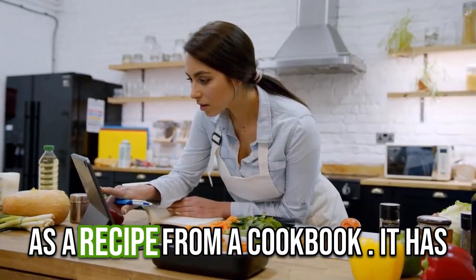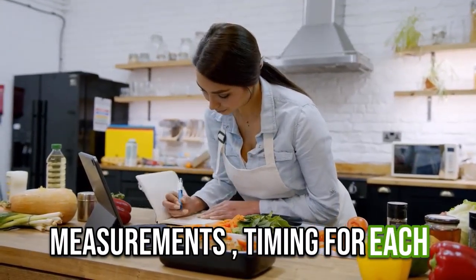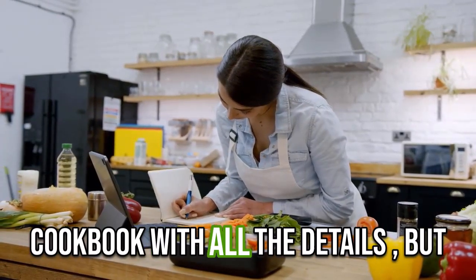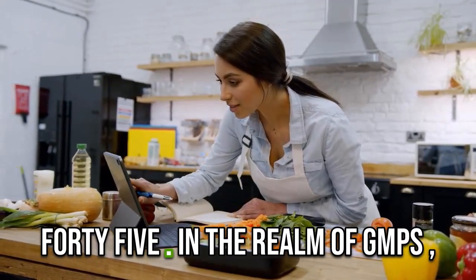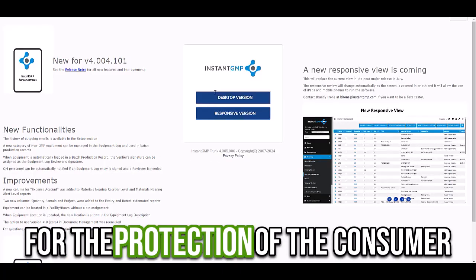Think of an MPR as a recipe from a cookbook. It has instructions organized with measurements, timing for each activity, ingredients, and cooking equipment. A BPR is a copy of the cookbook with all the details. But here you record what you did to make the recipe. Maybe you baked it for 35 minutes instead of 45. In the realm of GMPs, you need to record this metadata for the protection of the consumer.